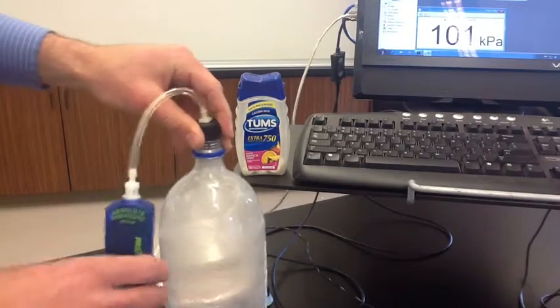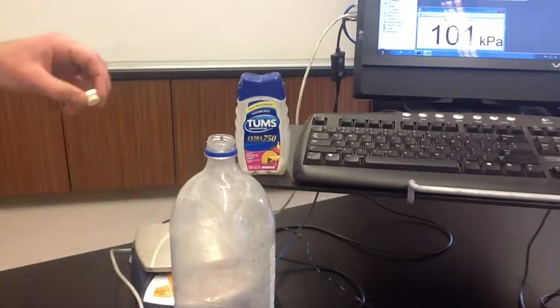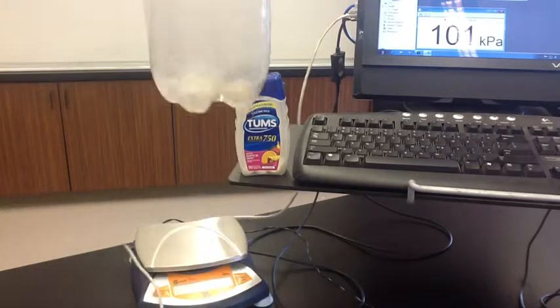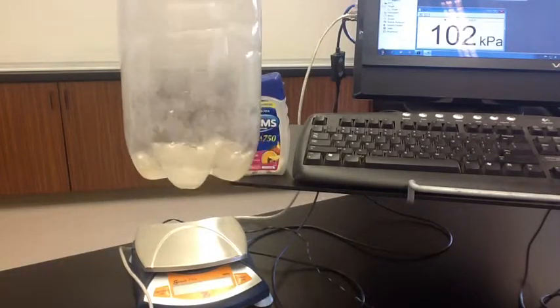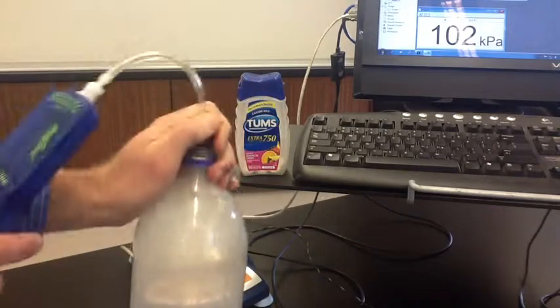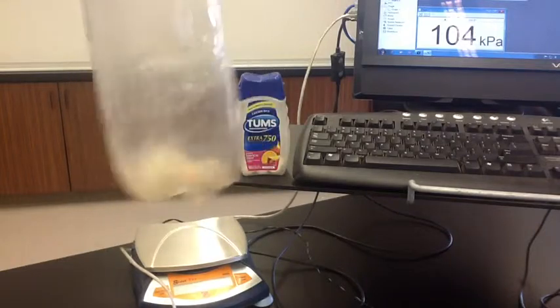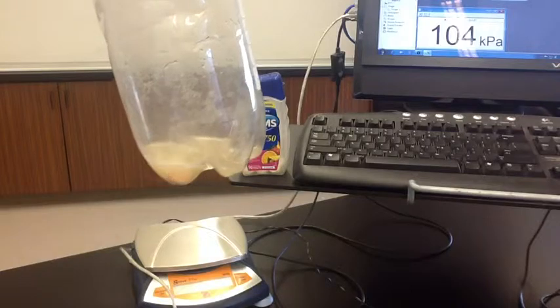We're going to take our two Tums tablets — 3.9 grams of Tums — and drop those in, and we're going to see how the pressure changes. You can see the reaction taking place. The Tums tablets are reacting with the hydrochloric acid. You can see those bubbles — they're producing carbon dioxide gas.